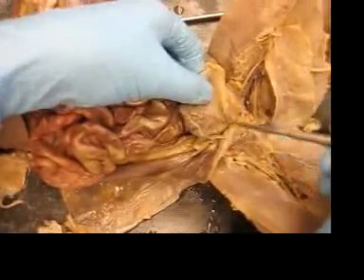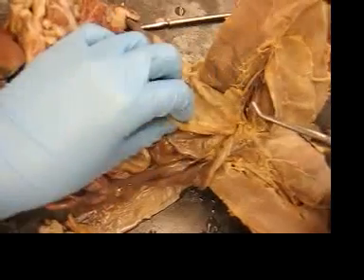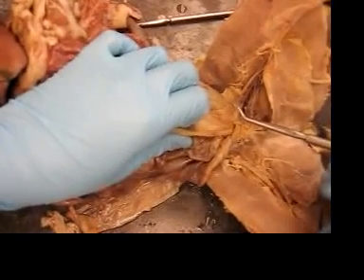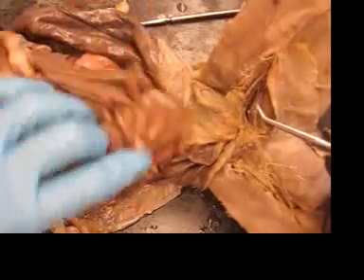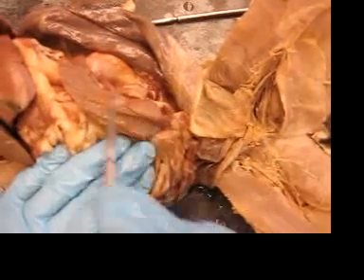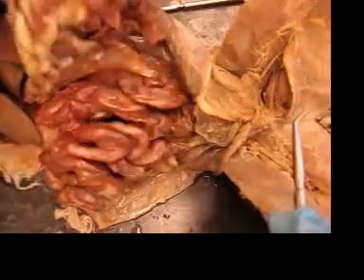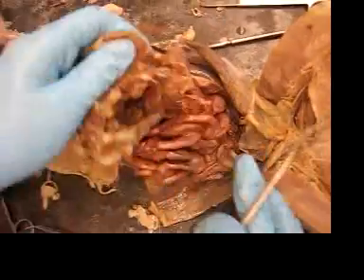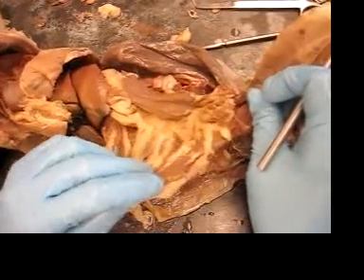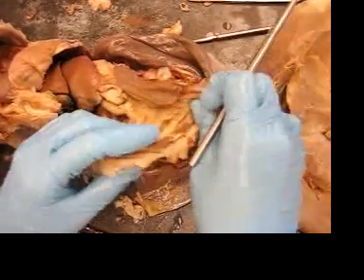Right here is the urinary bladder. Right here is the spleen. All of this that is sitting on top of the small intestine is called the greater omentum.